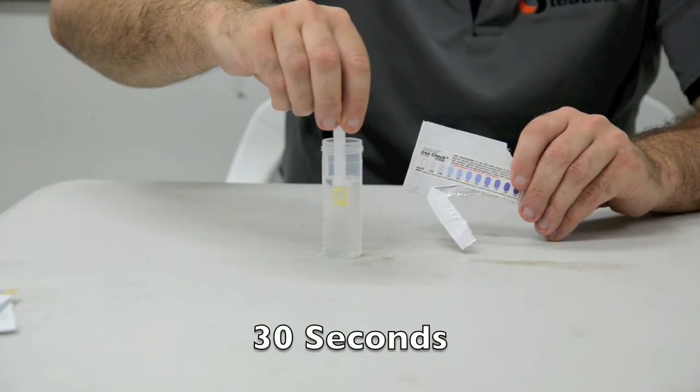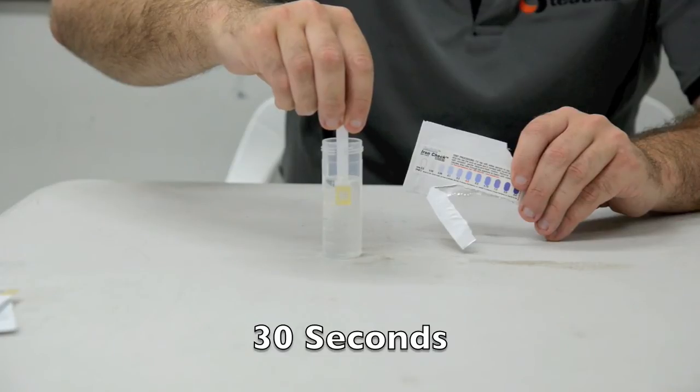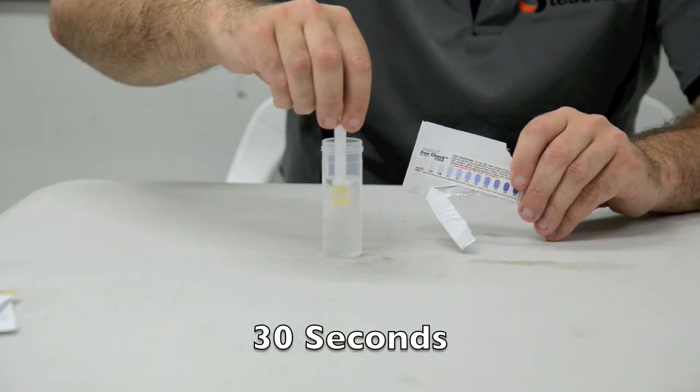Once you've removed it from the packaging, put your test strip in the sample water, moving back and forth for 30 seconds.